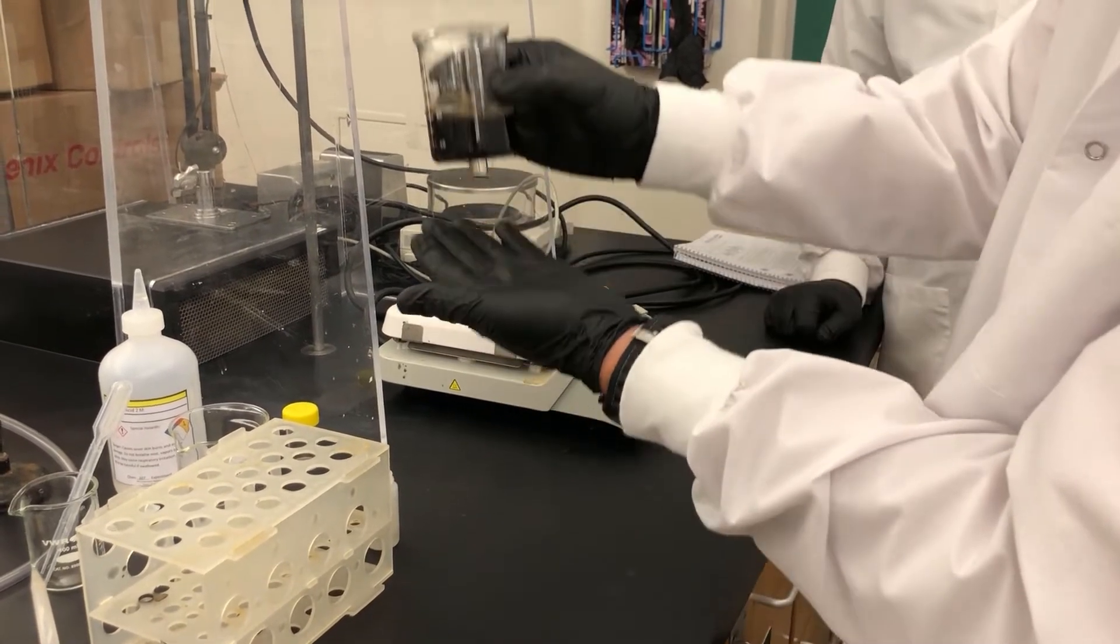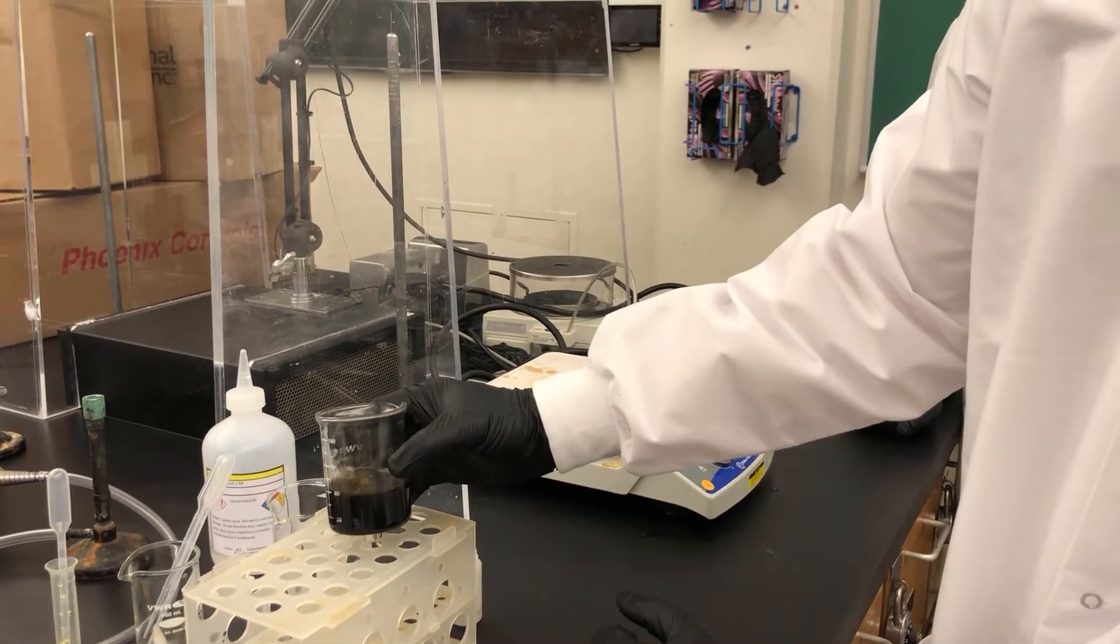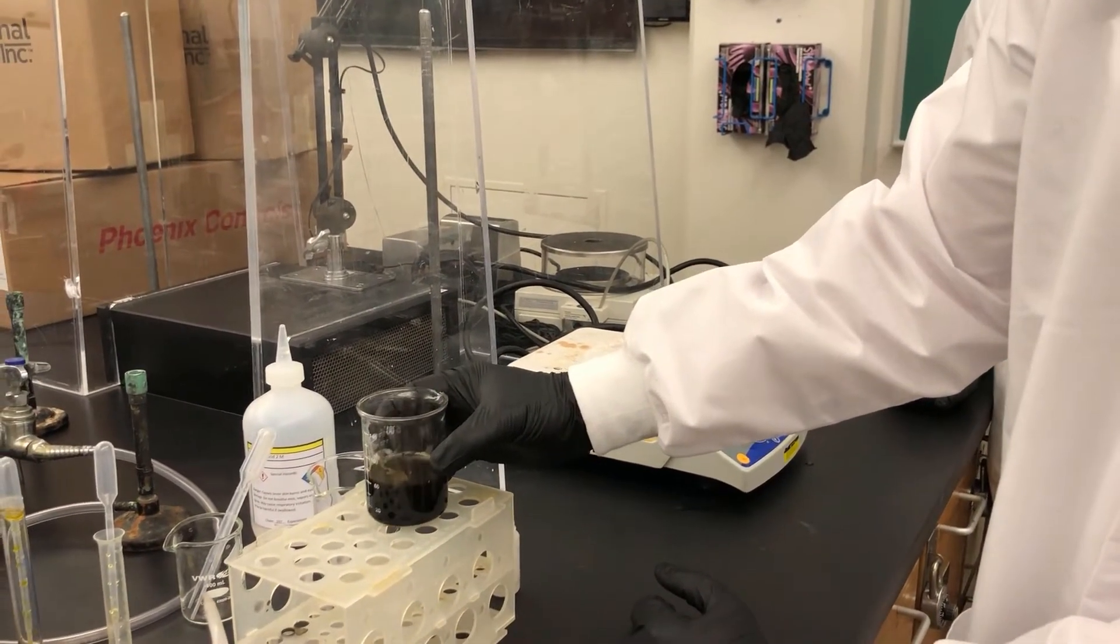I'm going to place it underneath and kind of let it grab most of this. As you can tell, it's holding onto the bottom. So to make sure that we can stabilize it, I'm going to place it on my test tube rack.